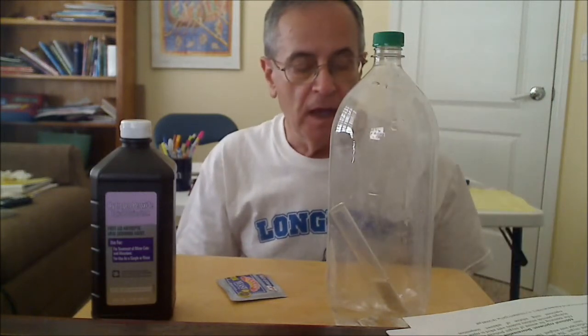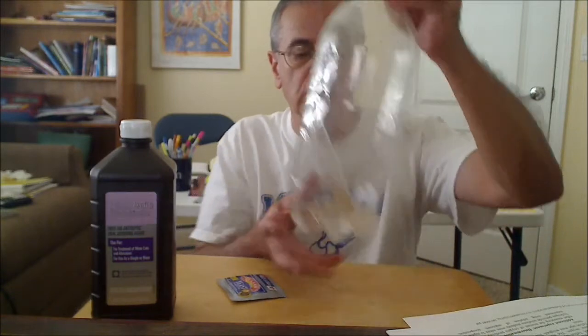But then I'm going to let the oxygen come off, and I'm going to weigh the bottle again. I think I mentioned I weighed it initially. I'm going to weigh it again after maybe 10 or 15 minutes. And from the weight change, I'll have the mass change. I'll have the mass of oxygen that was produced. And from the mass of the oxygen and the stoichiometry of the reaction, I can tell what the percent yield is. And we'll do that later.